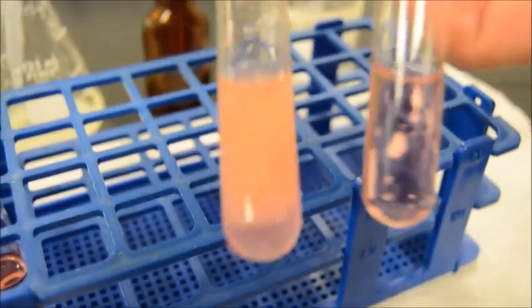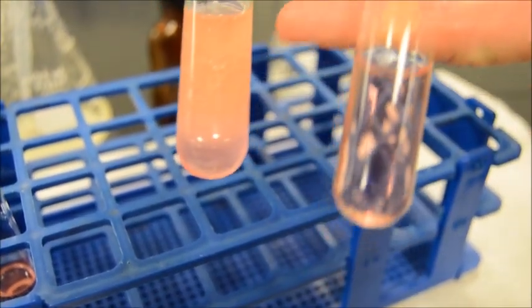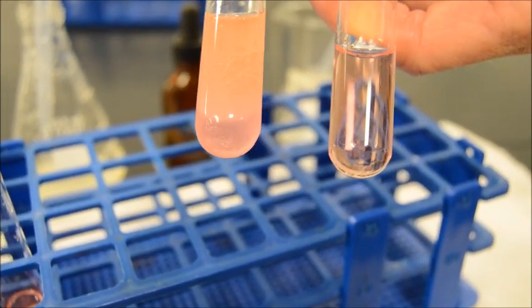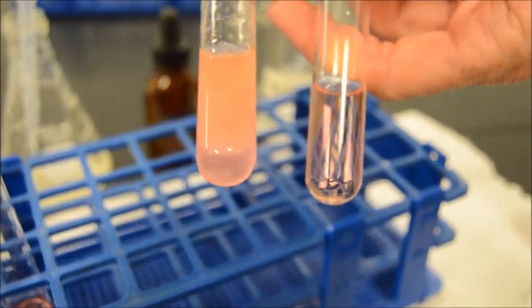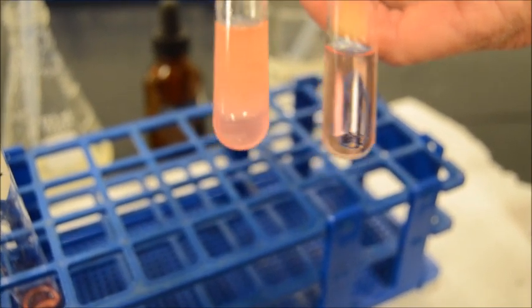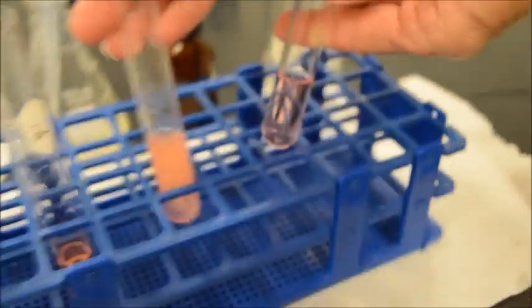And let's come back to the oil. See how you can see even more of a separation now that it's set just a little bit. And that will continue to progress over time. And we'll put a picture of that in at the end as well. Okay. Sounds perfect. And that's how you run a test for lipids.